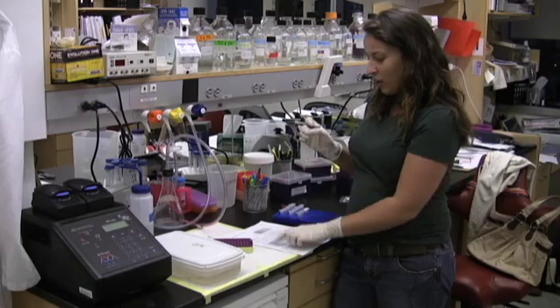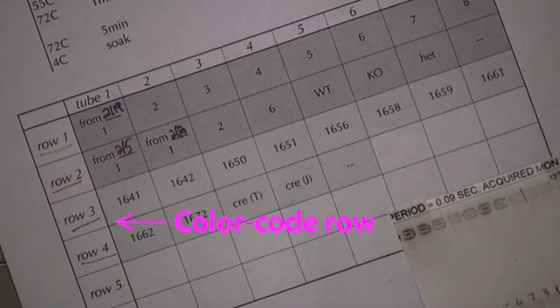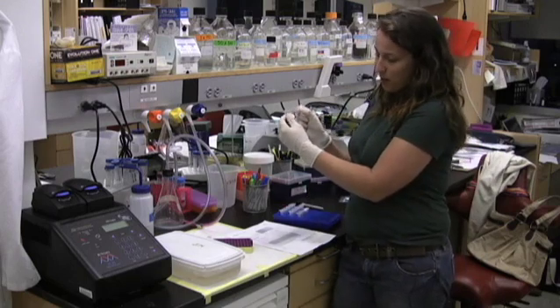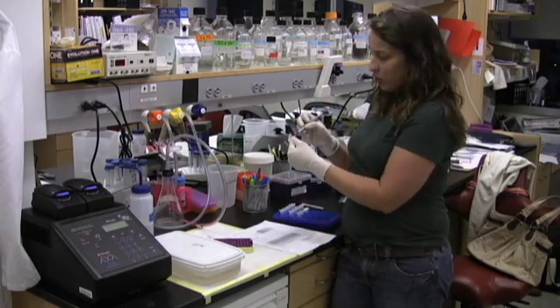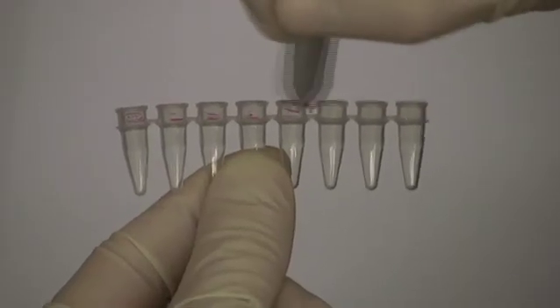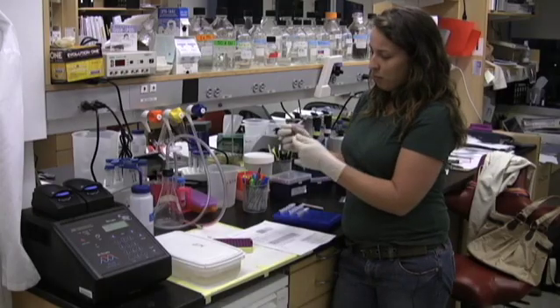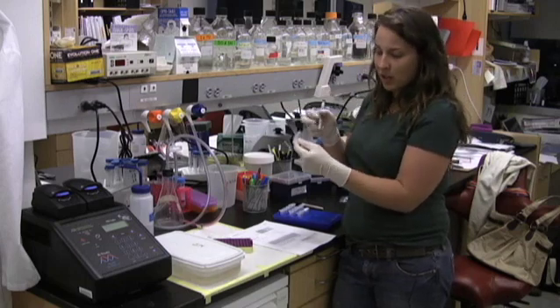And I draw a little line under each of my rows to color code which is which. If this is going to be tube strip number 3, it's pink. Take my Sharpie, and just really roughly go all the way across it. So that's pretty clear, and I don't have to squint, nothing's gonna get rubbed off, and even if it does get rubbed off, it's fine.